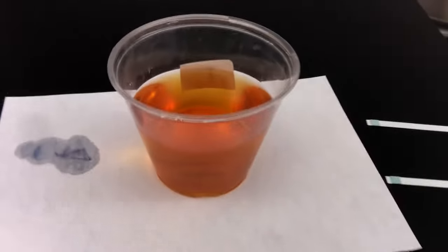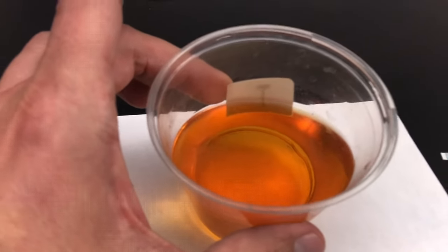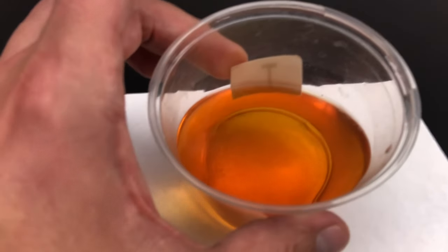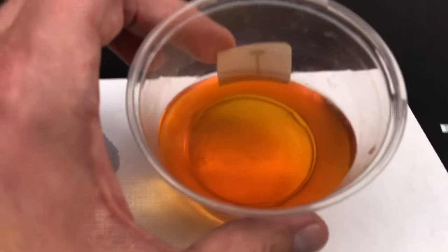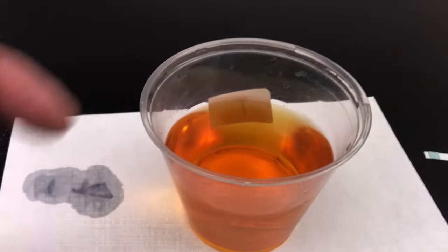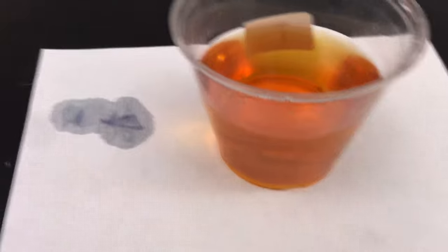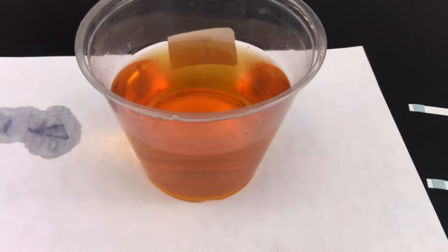If I look at the testing cup, it still has that same orangish bronze color from the iodine. I don't see anything different — no spots, nothing built up at the bottom, no color change. So the iodine-water mixture in the cup looks normal, just that same orange bronze color. That's an observation — I hope you know what that might imply.